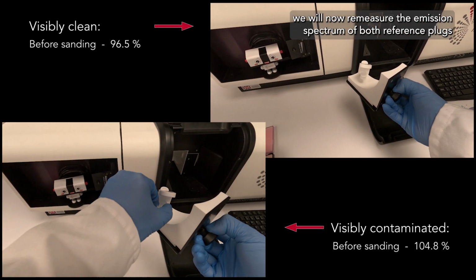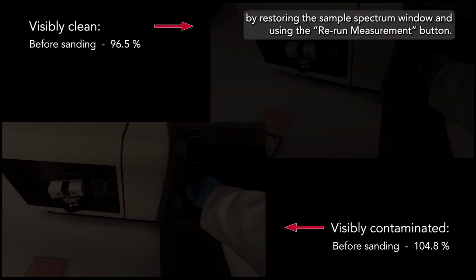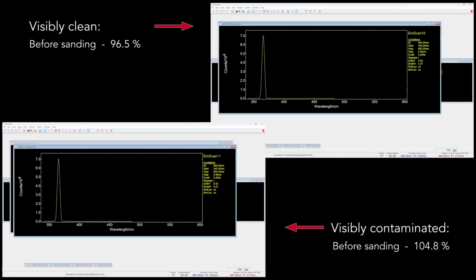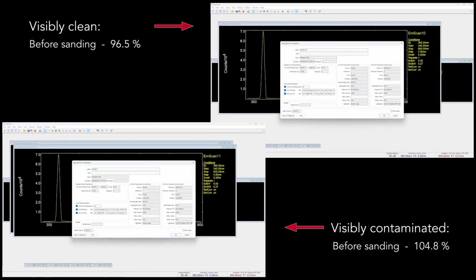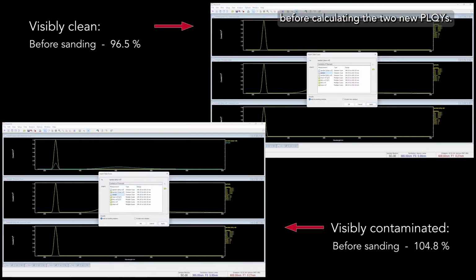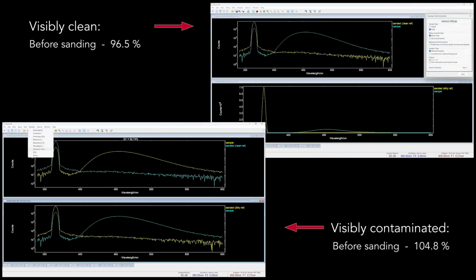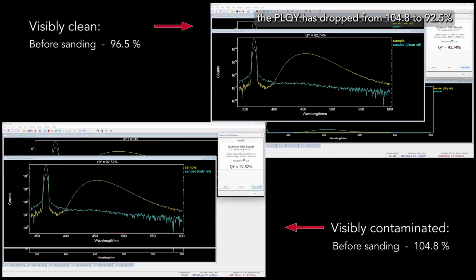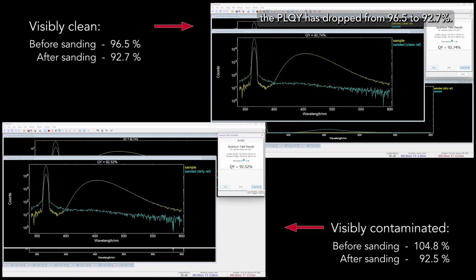Back in the Applications lab, we will now remeasure the emission spectrum of both reference plugs by restoring the sample spectrum window and using the Rerun Measurement button. I then insert the same sample emission scan from earlier before calculating the two new PLQYs. For the dirty ref, the PLQY has dropped from 104.8 to 92.5%, and for the clean reference plug, the PLQY has dropped from 96.5 to 92.7%. The result for both reference plugs are now in line with each other, as well as the expected PLQY of around 93% for this sample.